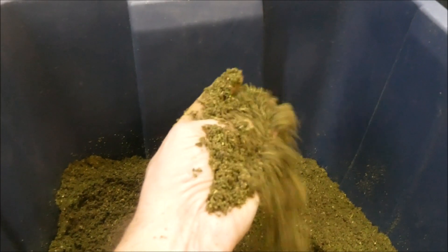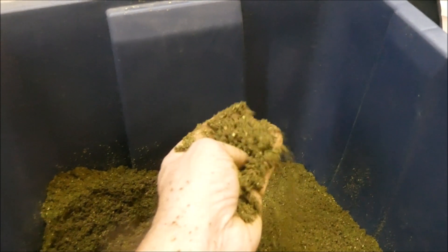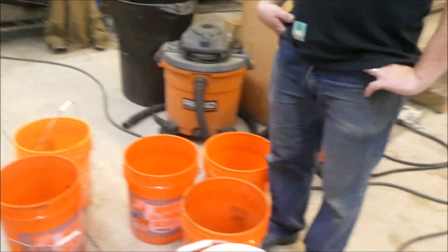Are you going to wash this through a second time? Yeah, that's the plan. Good — you should get a lot more out. What I would do is start at 80 and maybe go up to 100. In terms of the cone pressure? Yeah. And then just check the temperature — if the temperature feels fine, you're good.